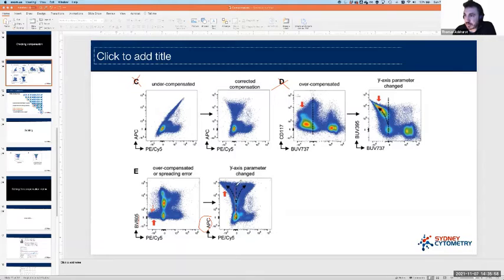Fundamentally, as the signal is getting brighter, it's spreading out like this. This is just revealing the measurement error that's inherent to our data. This isn't caused by compensation, it's just revealed by compensation. And importantly, there's nothing we can do about that. There's no kind of mathematical corrections we can apply to this, which will correct the situation.